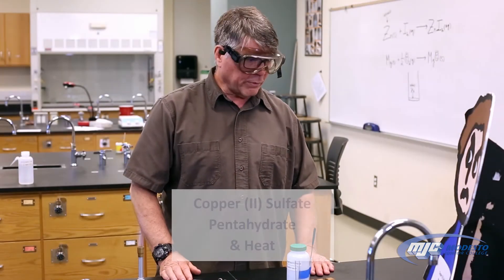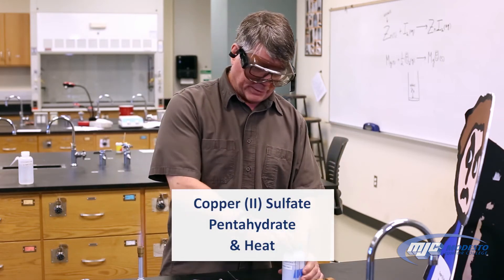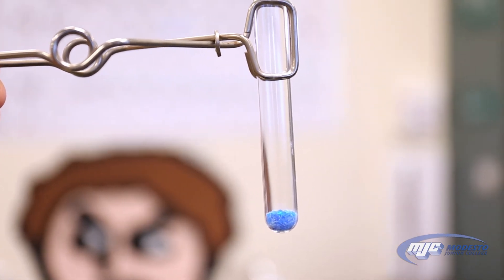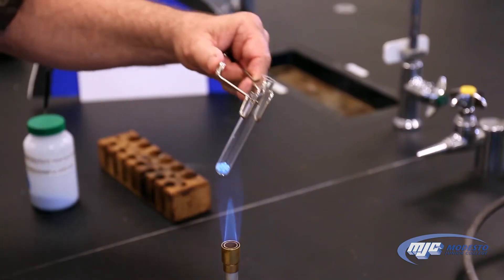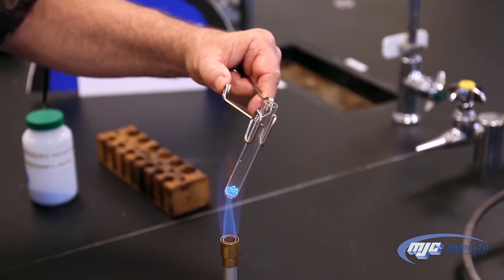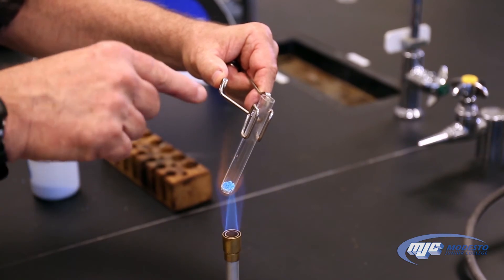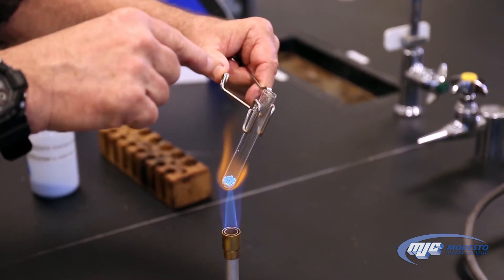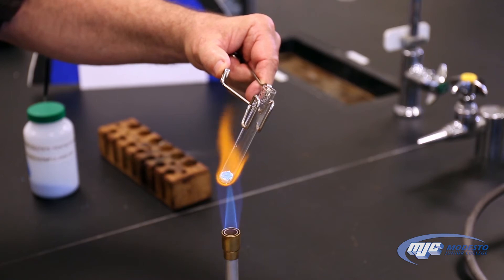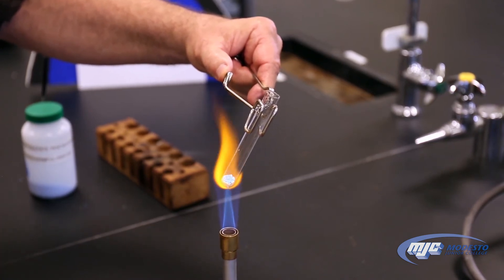This is the reaction, if any, when we heat up copper(II) sulfate pentahydrate. A really good observation, if you can see it, is there's some condensation around the top of the test tube in this case too. That's an important observation because it helps you figure out what one of the products is.